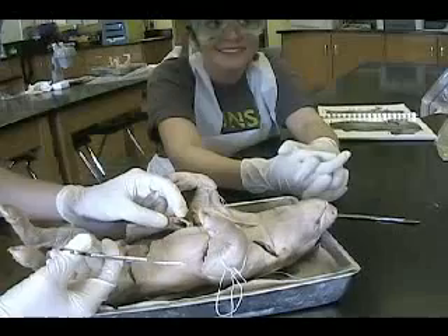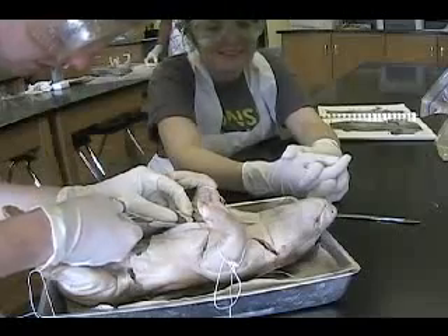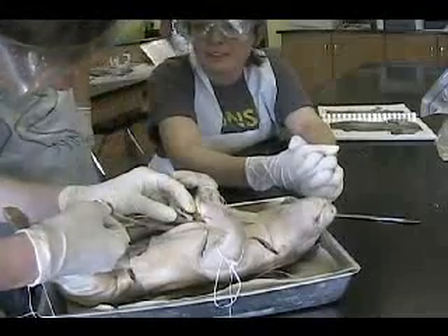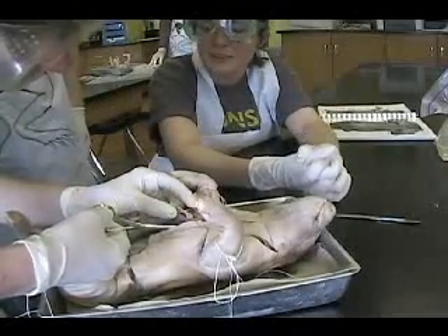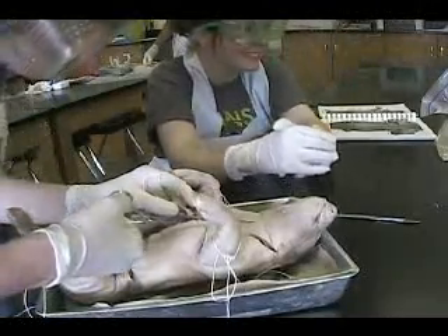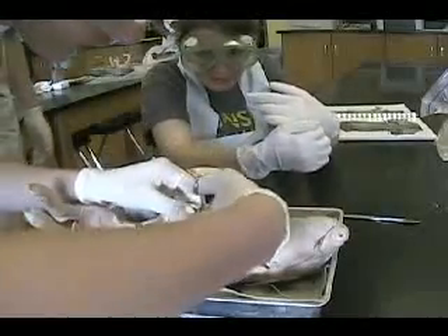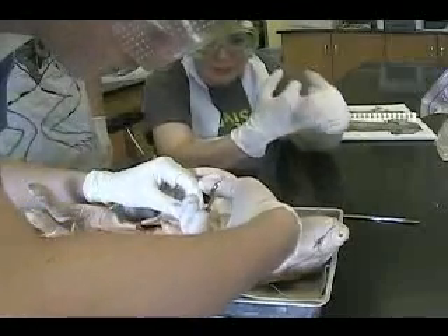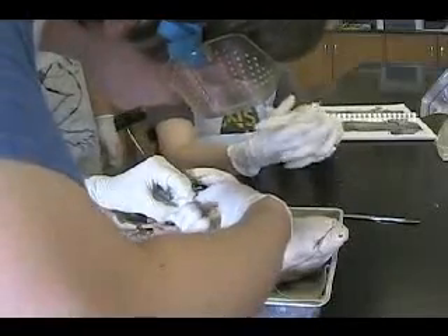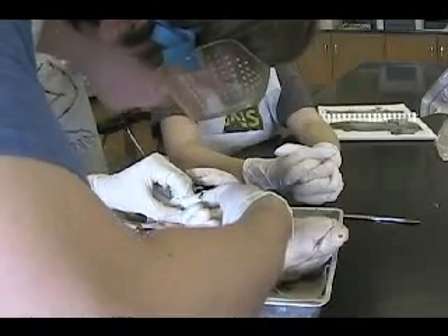It's a pig. Low angle — you're fine. Mine was deep. Maybe. This is optional. You can just go around and get some people.